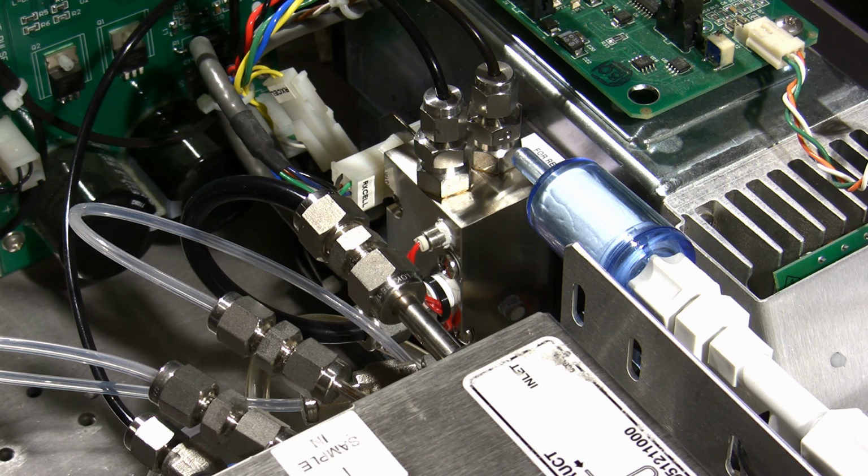So really, I'd say 6 months to a year, depending on how dirty your ambient air is and how frequently you're changing your filters, making sure that we're using that 1 to 2 micron sample filter to keep any ambient particulates out of the instrument. Those are going to be key to making sure that the reaction chamber has the longest life possible between these cleanings.